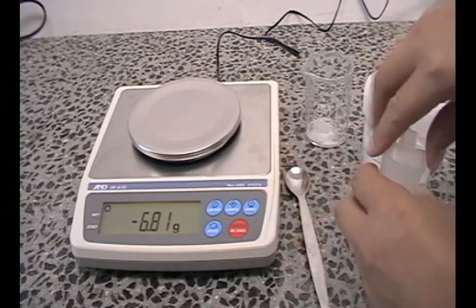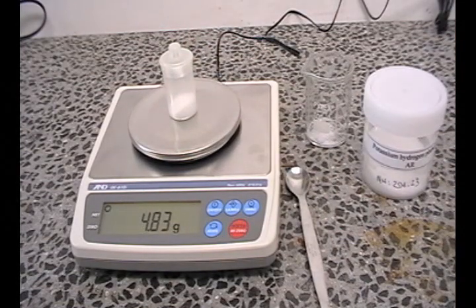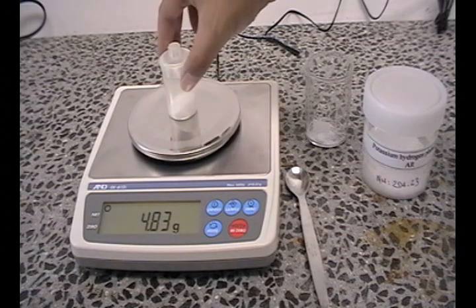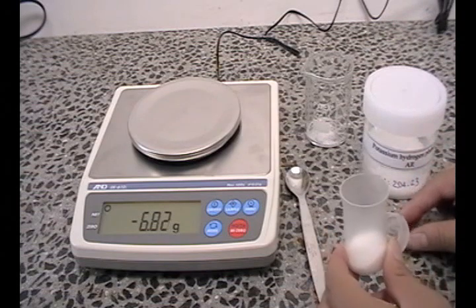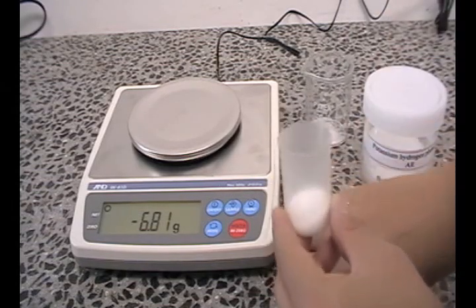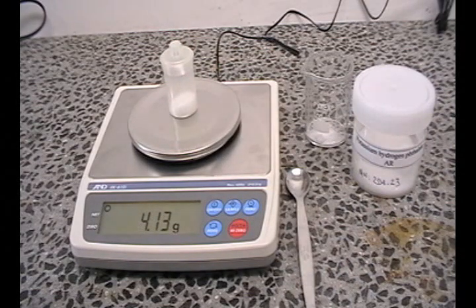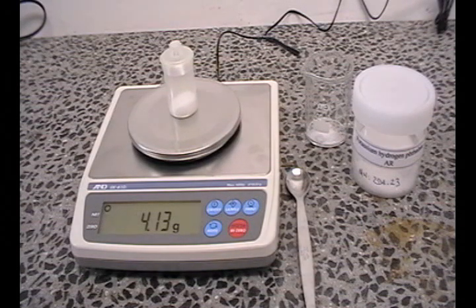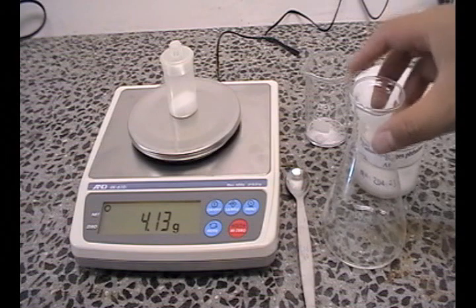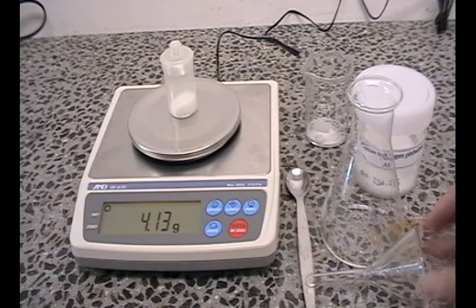Now let's re-weigh the bottle. It looks like we are still in excess. Let's take a little bit more out. Now let's re-weigh it. 4.13 grams. Now that's approximately 4 grams. If you are happy with this nominal amount, take your weigh bottle with the substance in it, a conical flask, a funnel, your lab diary and a pen into the analytical balance room.